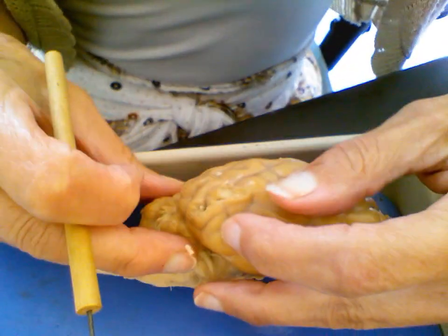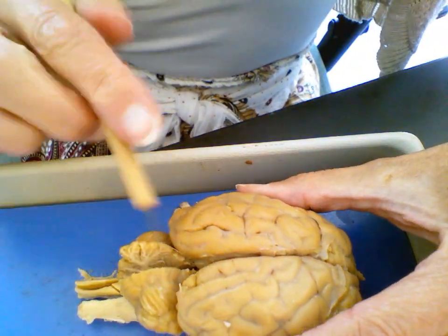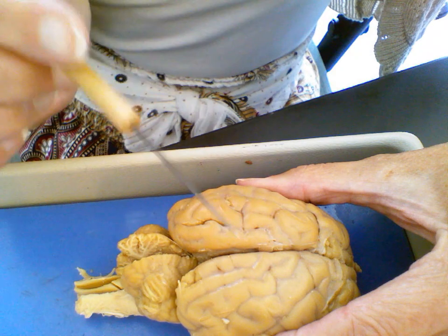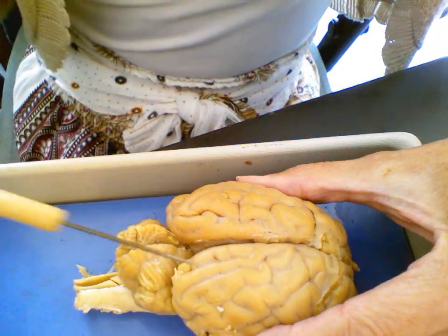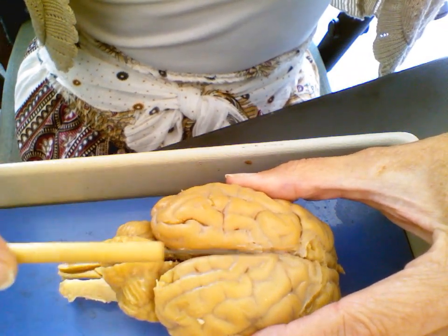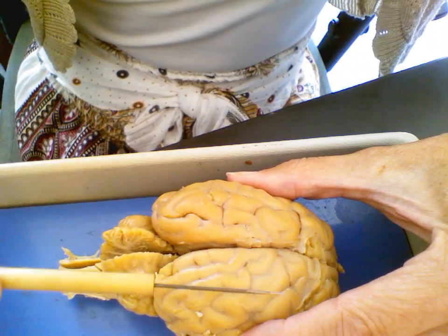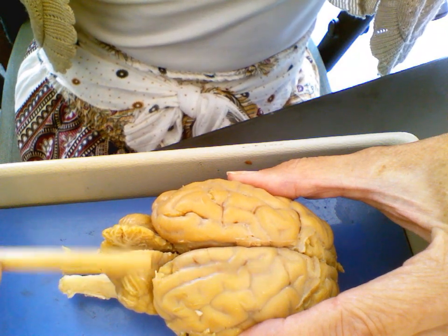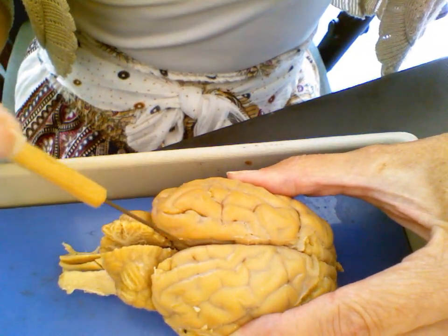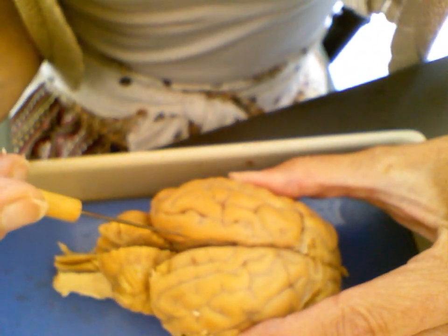Let's flip this back over. So now we're on the dorsal side of the brain, and we're looking now at the superior region, or the dorsal superior. We can use both. And on this side of the brain, what we note pretty clearly is that the brain is comprised of two large sides or hemispheres. Okay, so here's the right hemisphere, here's the left hemisphere, and those two hemispheres are actually divided by this midline that's a deep groove called the medial longitudinal fissure.